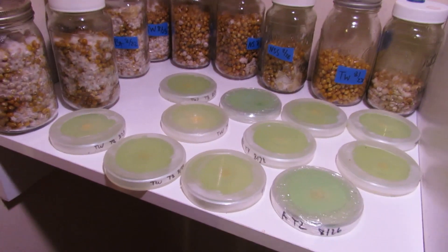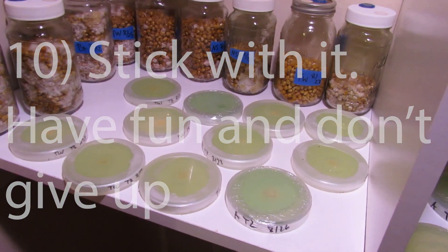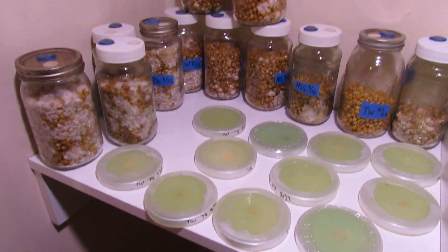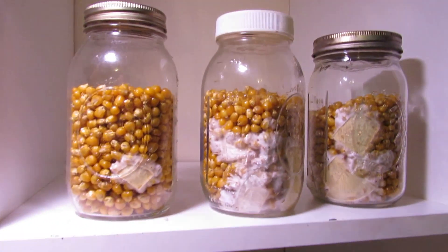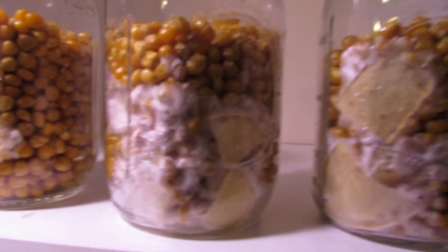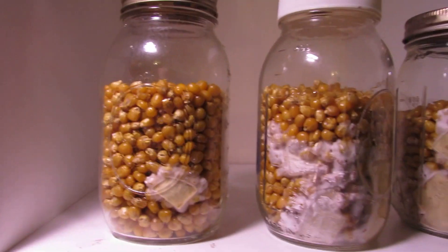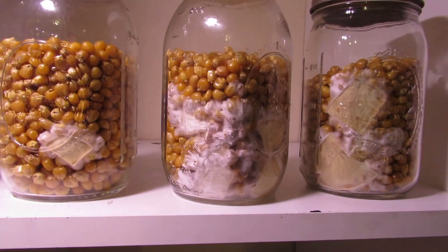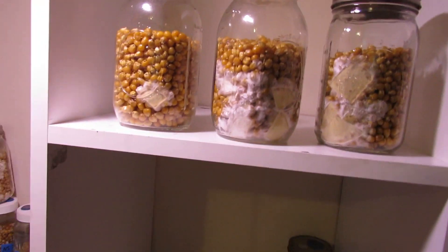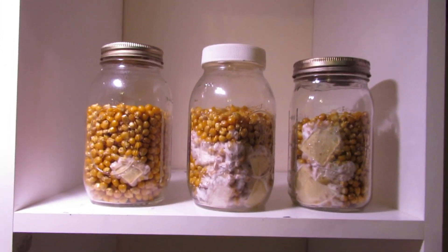Number ten: just stick with it. It's probably going to be really frustrating at first, but it definitely pays off — having jars that aren't all sweaty and funky looking, and having nice clean mycelium like the pictures on the shroomery message boards. I work exclusively with agar now so I can bring old spore prints back to life. Don't give up, you'll get there.